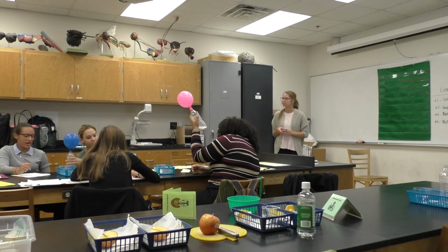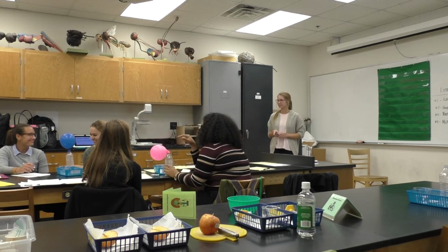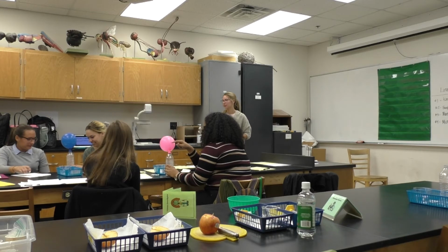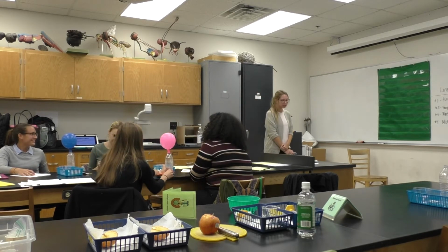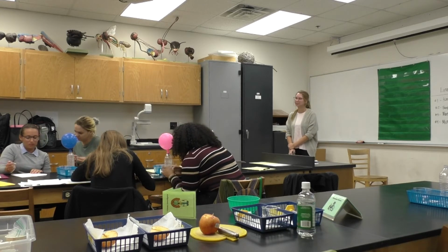This is pretty cool. Why is that? Why do you think that happened? Some kind of reaction happening. Make sure you answer all of the additional questions on your exploration guide.